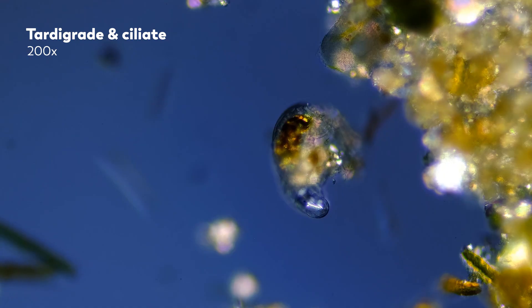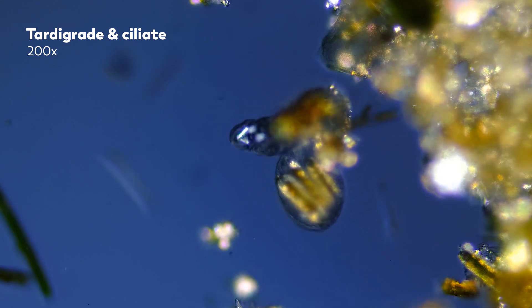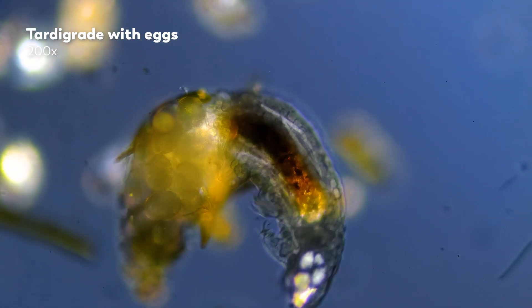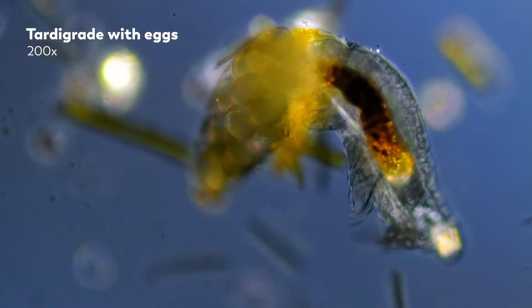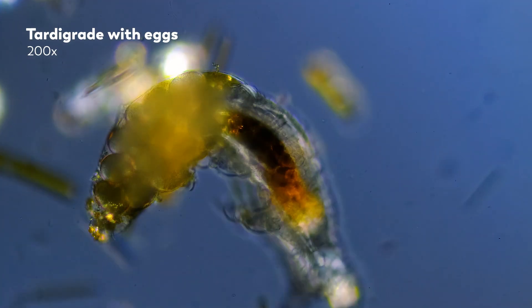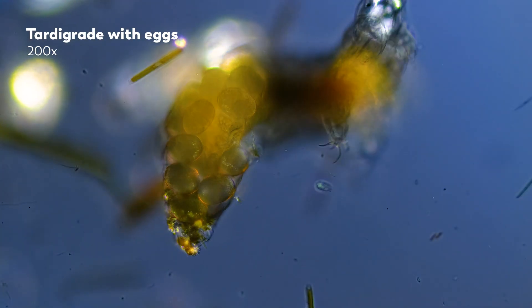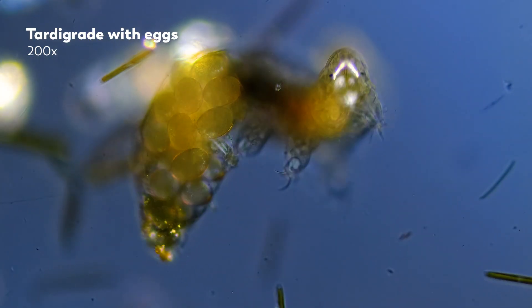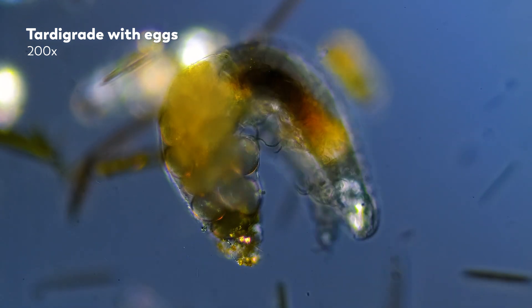For the last type of microscopy we'll go over today, we're getting into another property of light that we can't directly see — and this one can make the microcosmos glow. Most of the light we see has an electrical field that vibrates in all sorts of planes relative to the direction the light is traveling. But that vibration can be restricted to just one plane, and when that happens, the light is said to be polarized. We can't see the difference between polarized and unpolarized light — you might notice a difference wearing polarized sunglasses, but those changes are brought about by changes in color or intensity, not the polarization of the light itself.